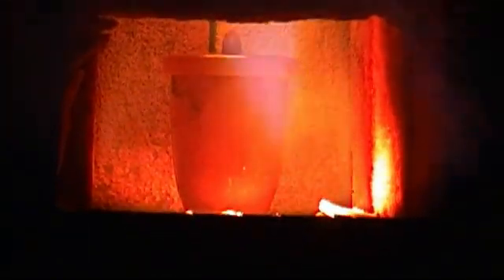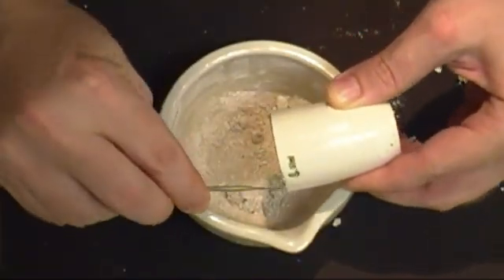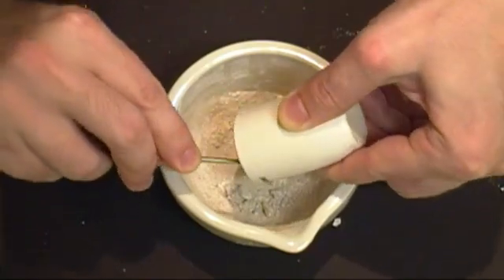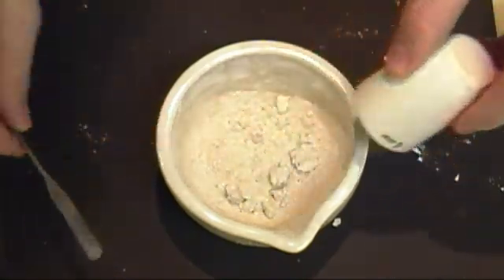I have modified it so the back opening is closed, and once the crucible is loaded, I close off part of the front. If you use one of these, or a kiln, then you will need to be sure the crucible is red hot for at least 30 minutes. After you are done, let the crucible cool before you begin removing what's inside. When you do start removing your product, try not to break any of the large fused chunks. While the video is about making powder, you will find that the large chunks glow the best and the longest. Powdering them reduces the effect to some degree, since you mix in all the dark spots.